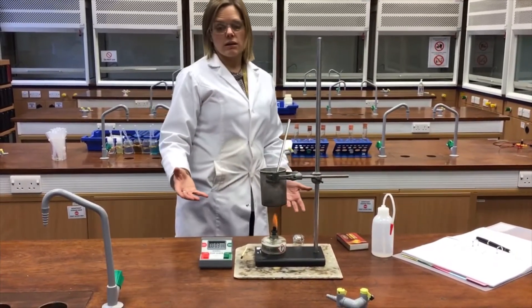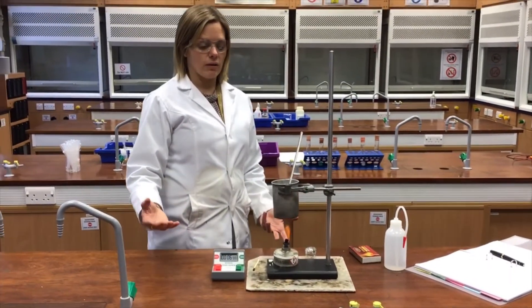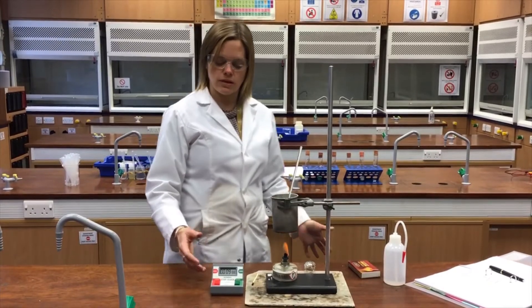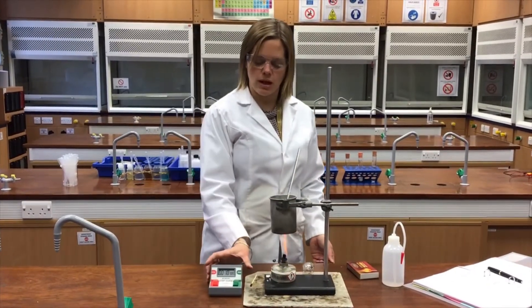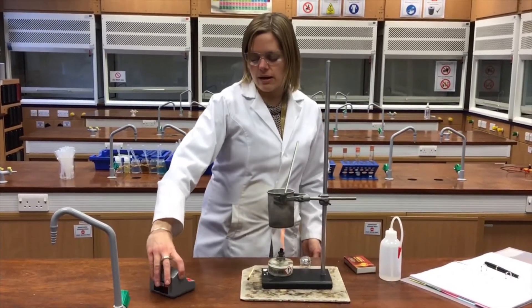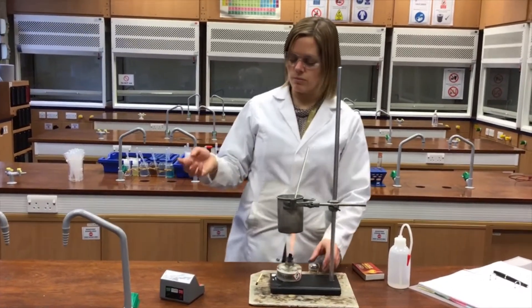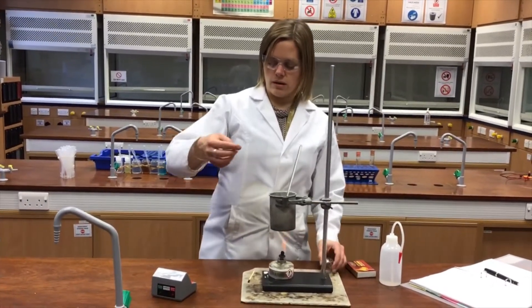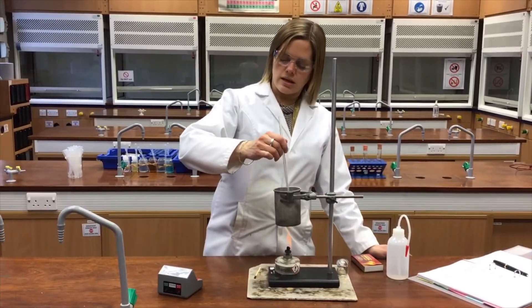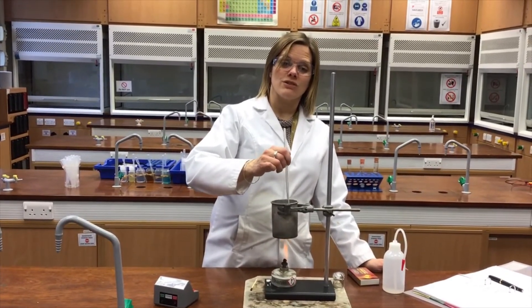The exact time doesn't really matter — it's just giving me an opportunity to see how long to run the experiment. I'm keeping an eye on the time. I'll heat it for two minutes and then check the final temperature.